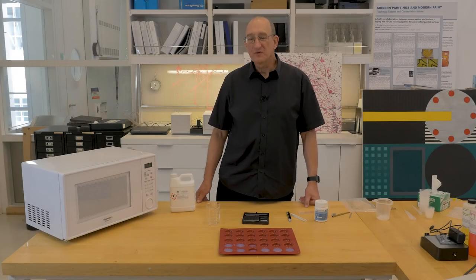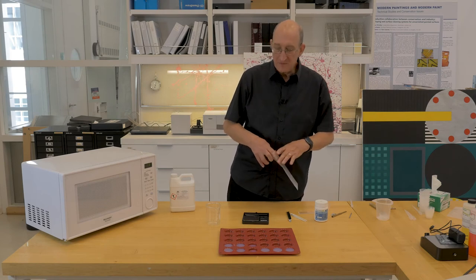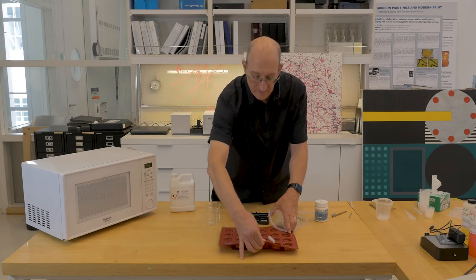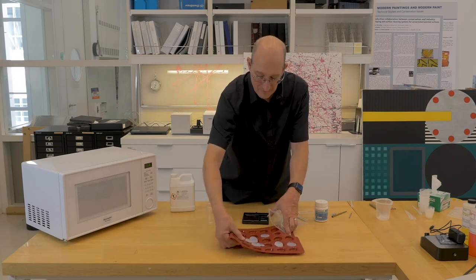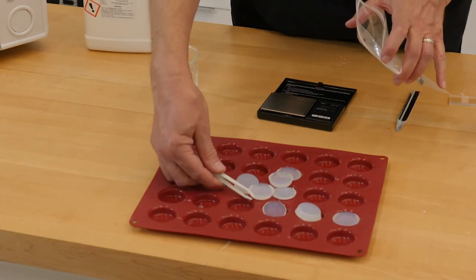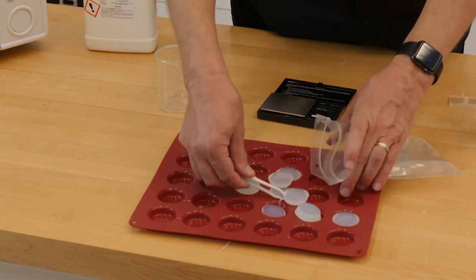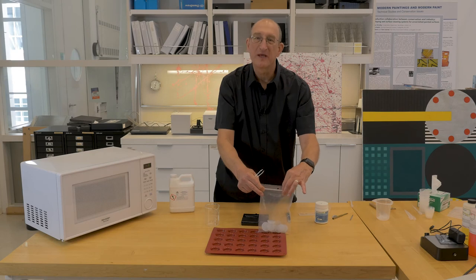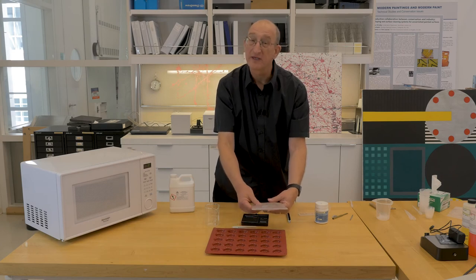We let the agarose cool in the macaroon mat. Now that the agarose is cooled, we can just pop it out of the mold and put it into a plastic bag. We don't want to touch the agarose with our fingers because there are salts on the fingers. Just use tweezers to pick them up and put them in the bag. They're in the bag — because we've added the Germaben, they won't grow mold for quite a while. You want to keep as little air in the bag as possible because they will lose moisture slowly and dry out.